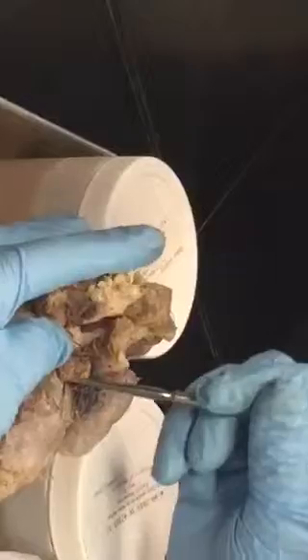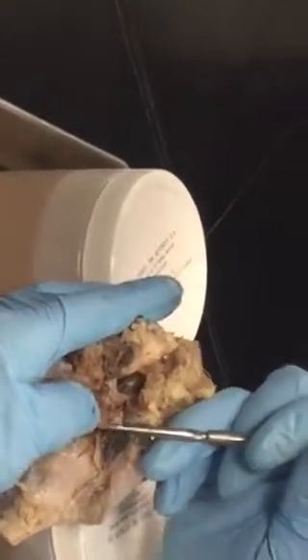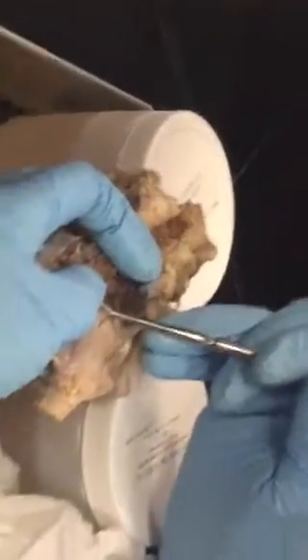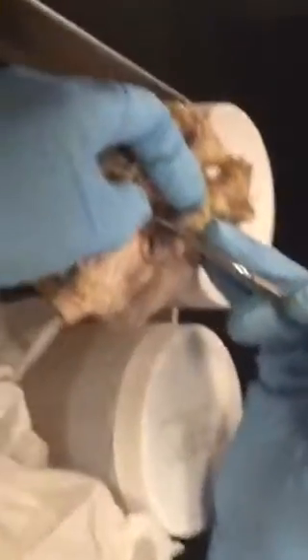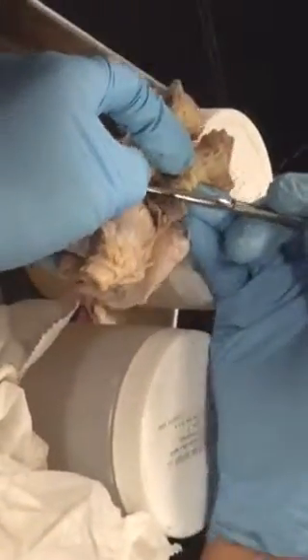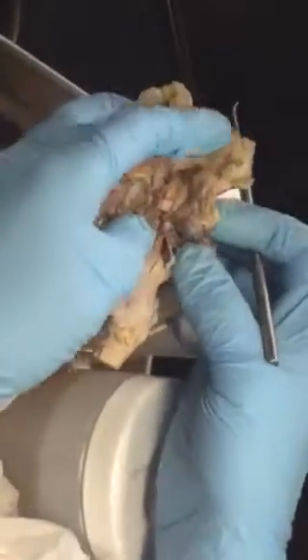It's already being torn apart a little. Let me see. Oculomotor. Yeah, oculomotor. Here, you can only see right now a little bit, the base. I will pop it up, and then later I will show you from the other view. Do you see this? It's flat, like a bean sprout, thin, like angel hair spaghetti. Oh, it broke. Oh gosh, okay.